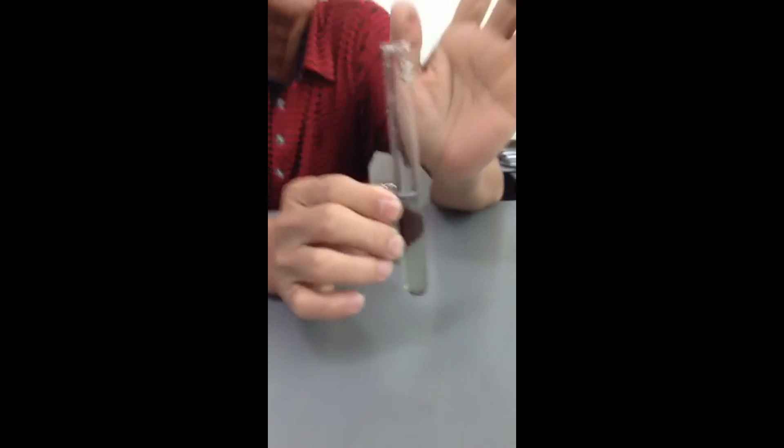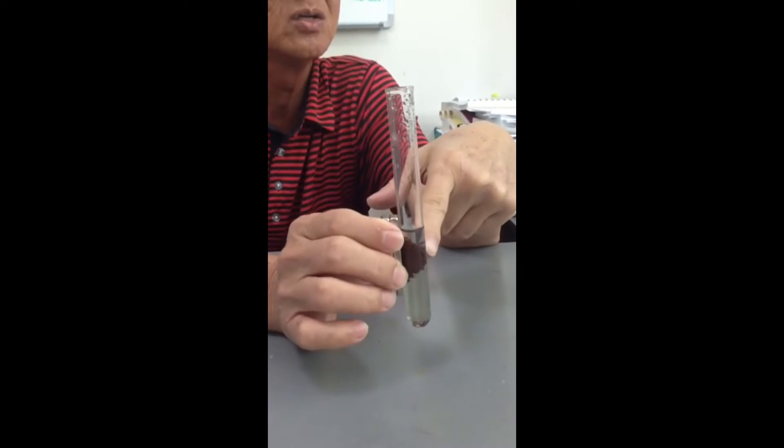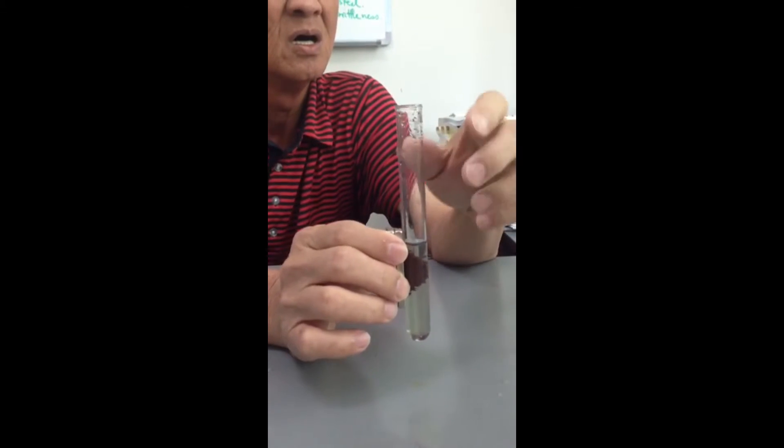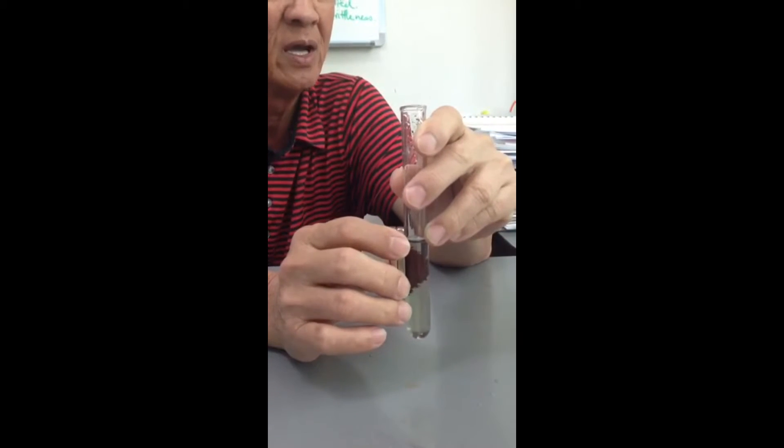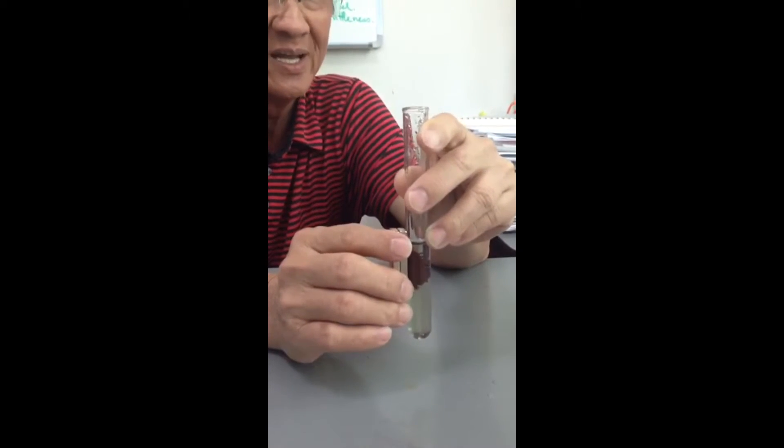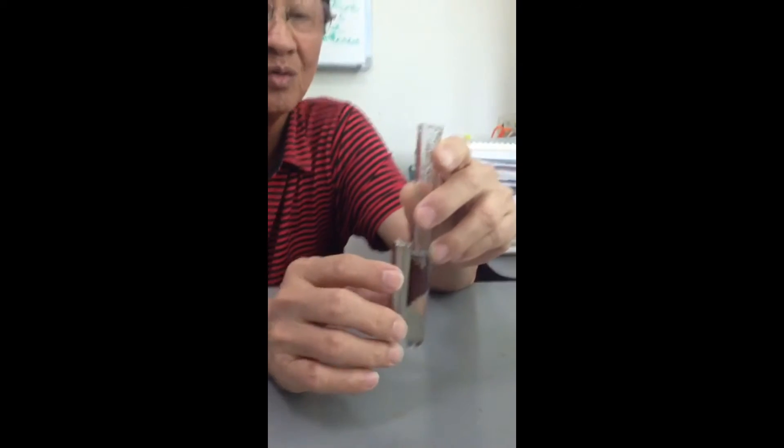Copper is not magnetic, but why is it still attracted? For iron? For iron, yes. Where? Inside. Yes, that's right.